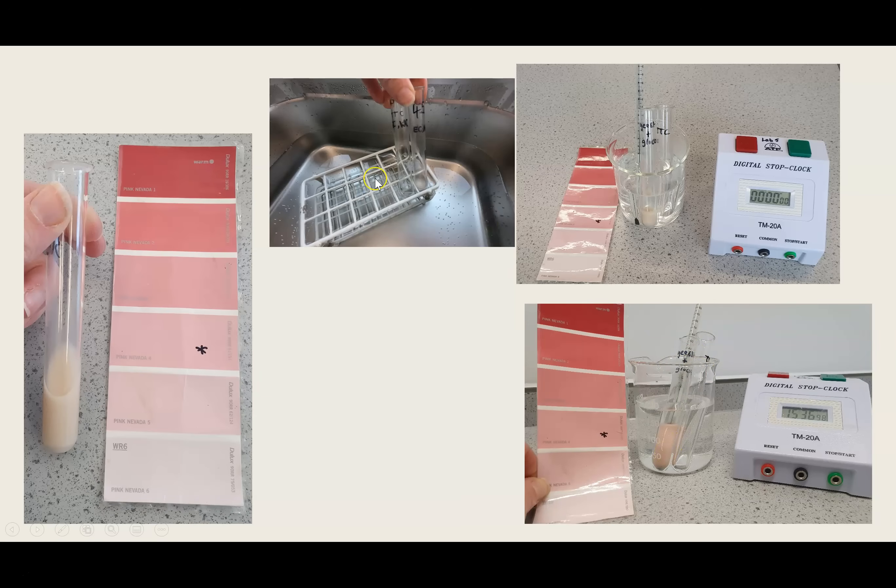Leave the solution in the water bath. I did actually use thermostatic ones, but because you can't see into them very well, I've also done one in a beaker as a water bath so that you can see the color changes. At the moment, this is at 30 degrees and it's up to 15 minutes, 36 seconds. Comparing it, it's still not quite at the shade of pink that I have highlighted. We'd still need to leave it a little bit longer. At the moment, it's somewhere in between these two.